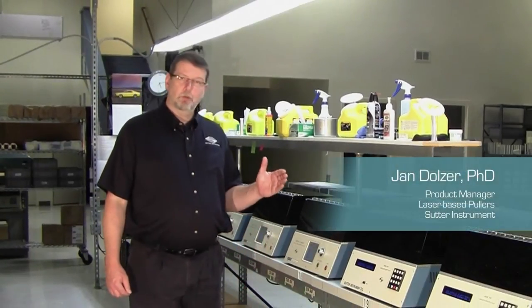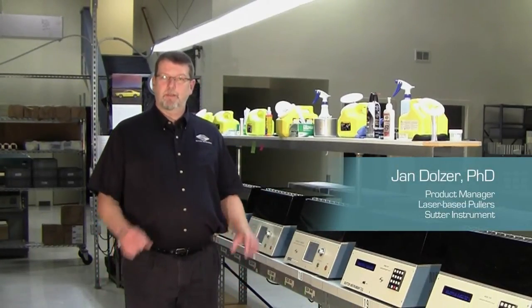Hello, I am Jan Dolzer at Sutter Instrument. Today we will show you a short tutorial about the puller bars and the V-groove bearings that position and guide them.